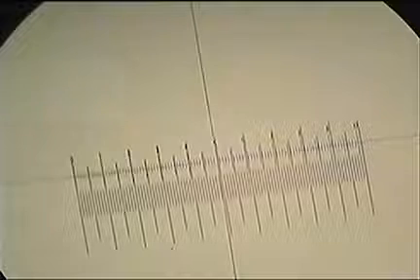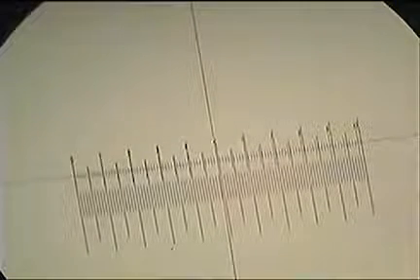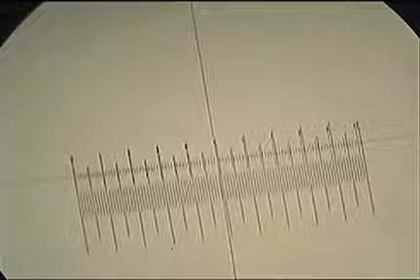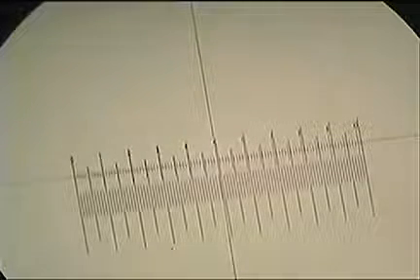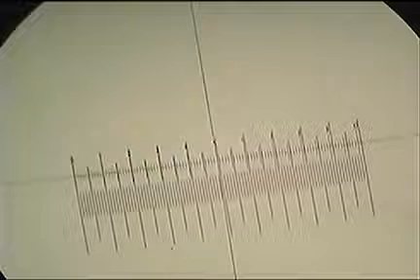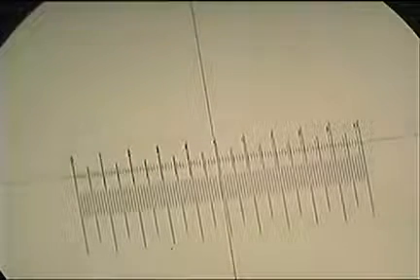Looking for a line at the other end that lines up, and I'm looking along the eyepiece at about 9.6. So on the eyepiece, the top scale, at about 9.6, I've got two lines that are lying exactly one on top of the other. So we'll write that down, 9.6 for my eyepiece. On the stage micrometer, what distance do we have there?